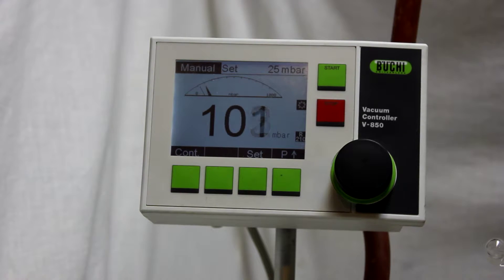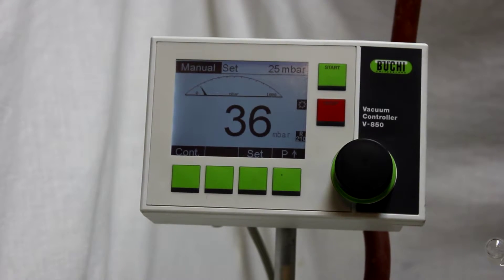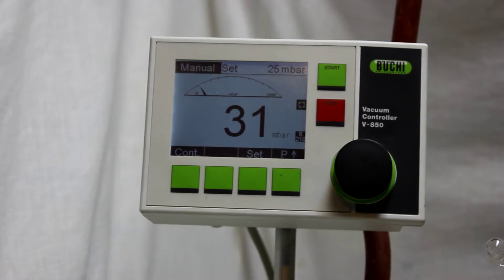Almost 100 millibar, and now it's close to 51. 51, 30 something. So when it's getting close to 25 millibar, as you can hear, the speed of the motor of the vacuum pump is just gonna decrease.